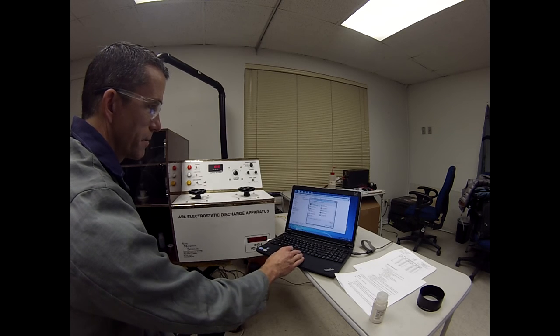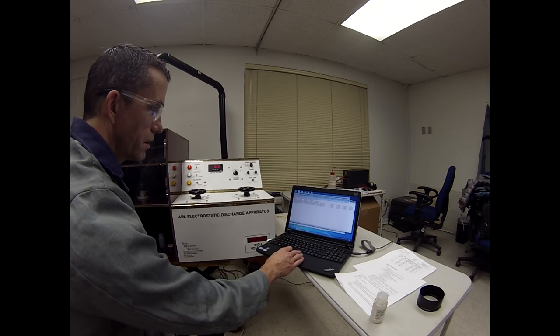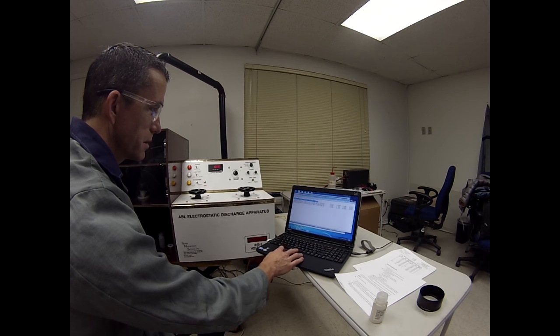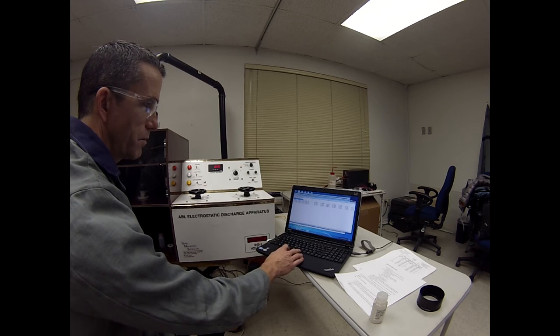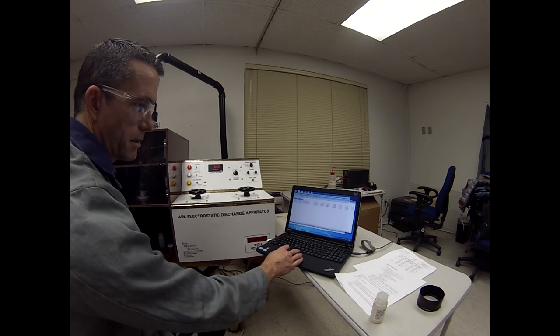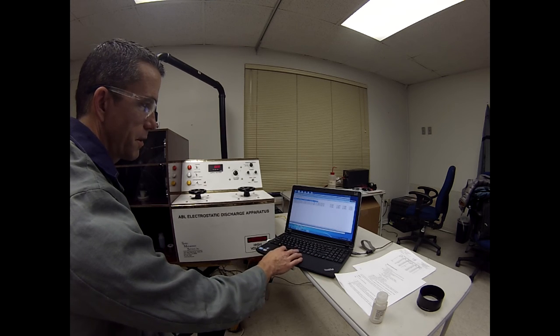You can see here, this is the brightness, buoyancy, shape, uniformity, color from the background, and it lists which background it used to get those baseline shots, their mean and standard deviation. And then here are the brightness, buoyancy, shape, uniformity, and color values, and then the linear combination of those to yield that trial value. And it compares each one of these individually to the baseline values to arrive at that trial value, and then lists no-go, and then summarizes 0 out of 5 there.